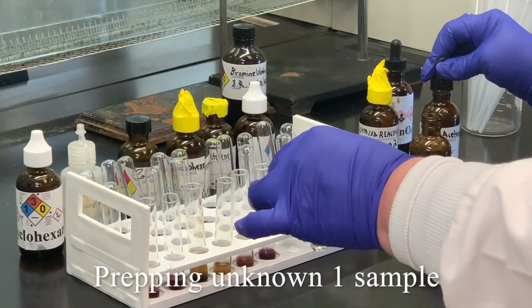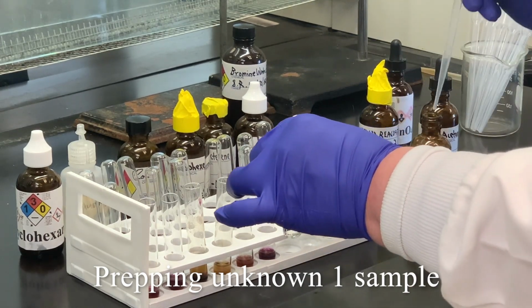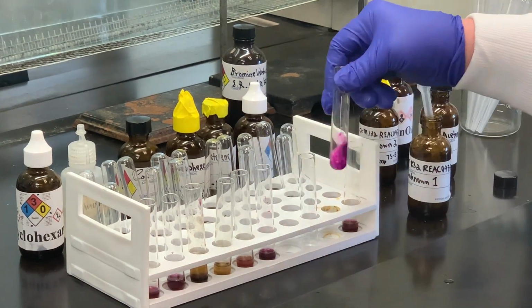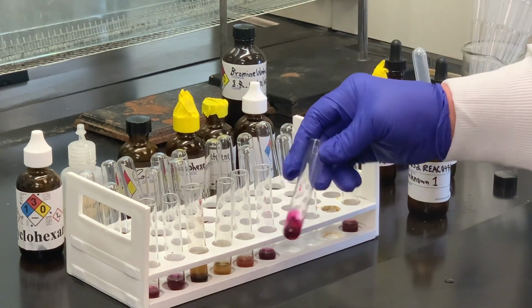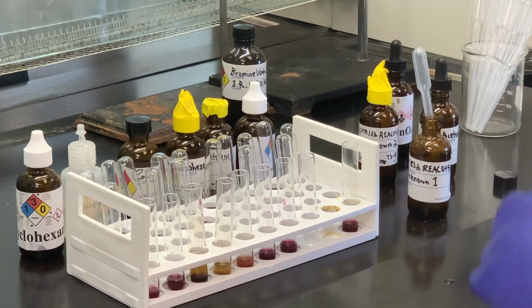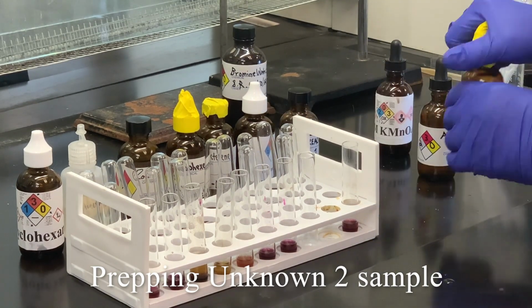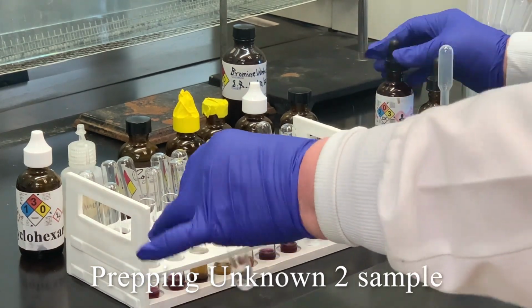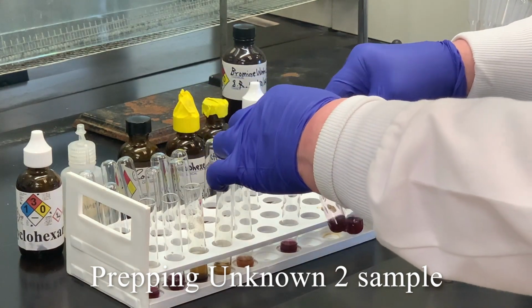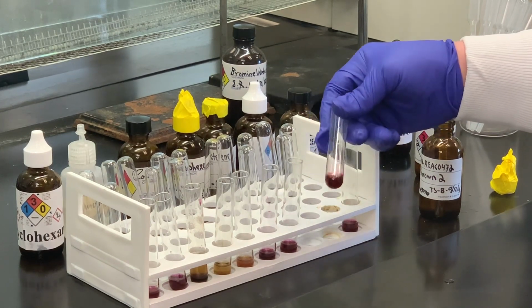Put some acetone, followed by a couple drops of our unknown. I'm not seeing much going on there with that particular one. And then the last one we're going to test is the unknown 2. If I compare it to the toluene that we did before, looks like it is changing somewhat.